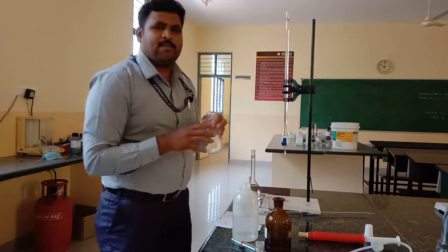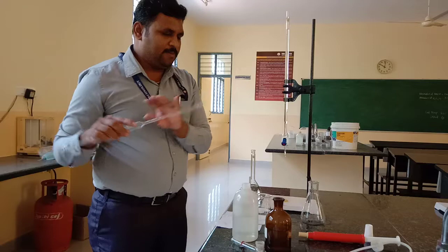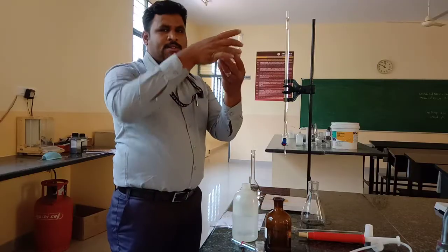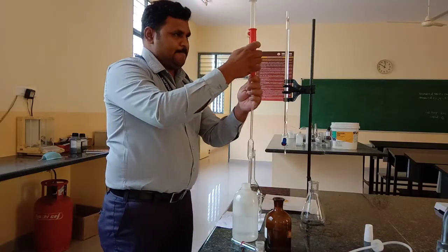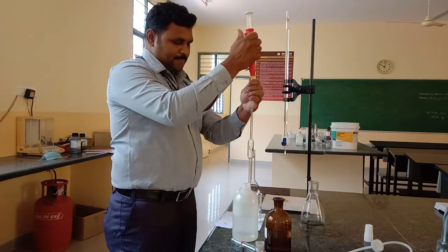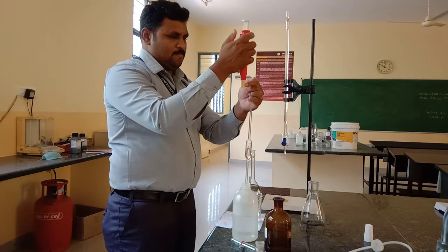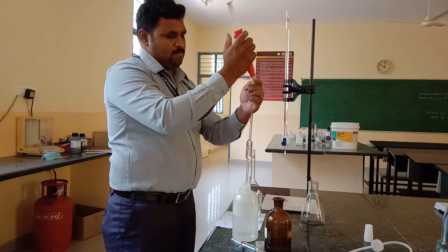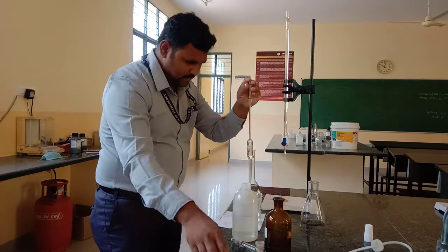Then take a clean 250 cm³ conical flask and a 25 cm³ pipette. Pipette out exactly 25 cm³ of the hard water sample using a pipette pump.